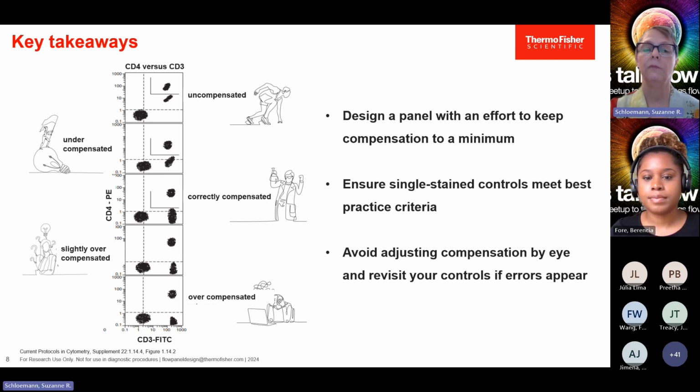Here we see a slightly overcompensated sample. And if you were to compare the median fluorescence intensity of this population to the median fluorescence intensity of the unstained, you would see that this one had a lower fluorescence intensity. It's a little overcompensated. And then there are severely overcompensated samples sometimes. Again, compensation would need to be adjusted to bring the median fluorescence intensity of this population into parity with the unstained samples.